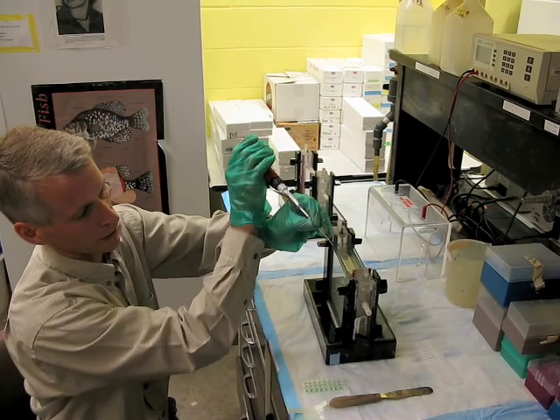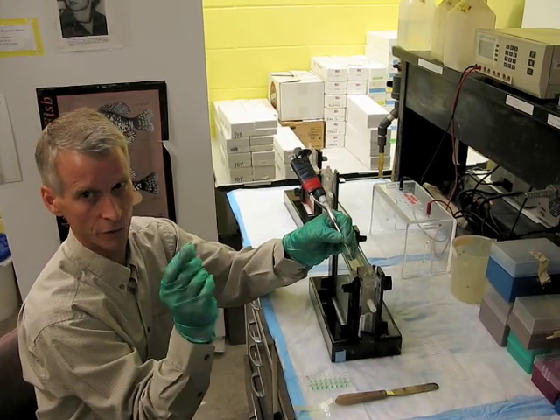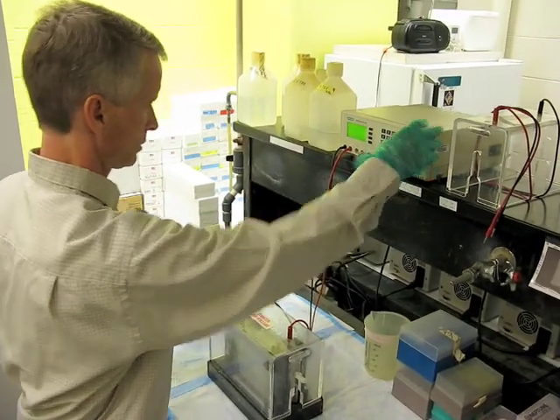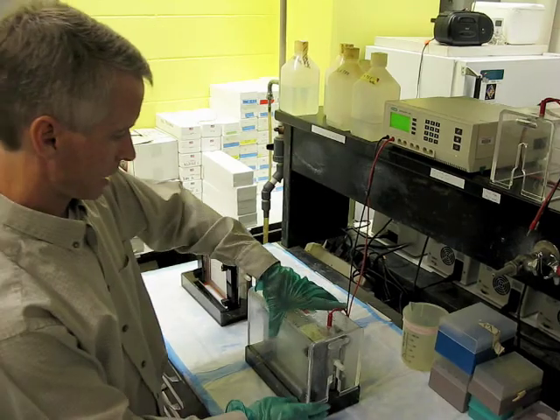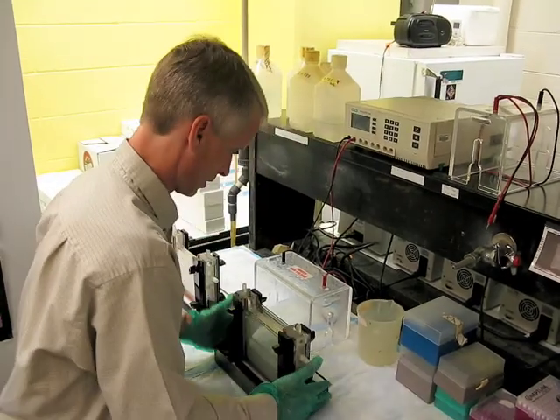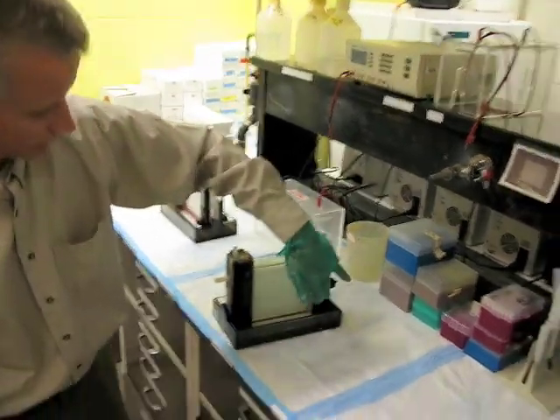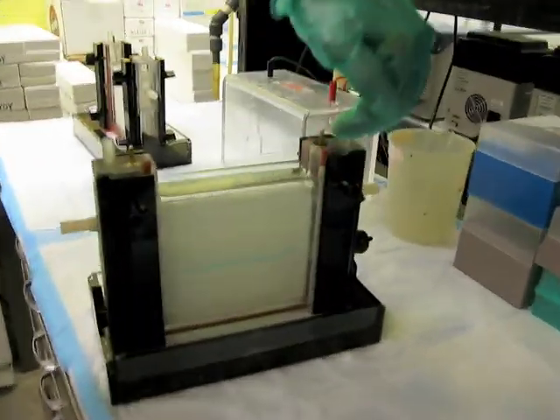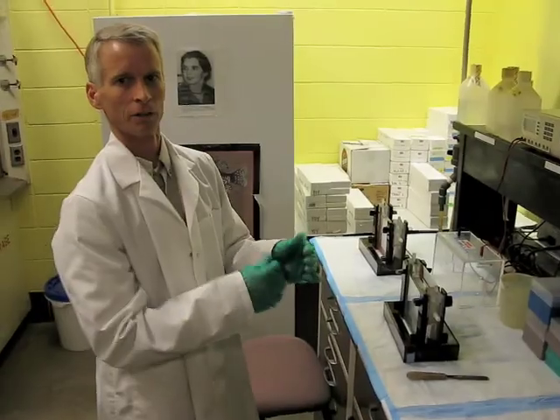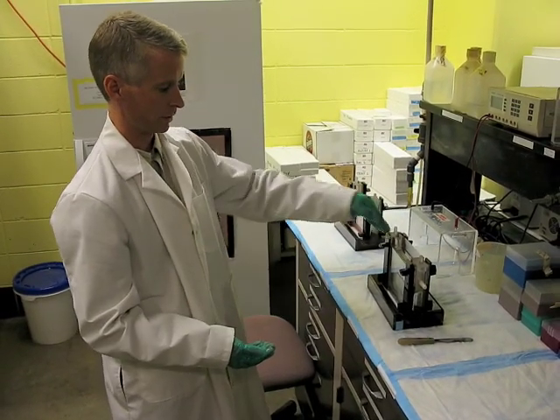I've got a really fine tip, because these plates are only 0.8 millimeters thick — the gel itself. And by twisting it around, it's probably hard to see on video, but there's a tracking dye that shows us we've got some samples running. The electricity has been pulling the DNA from up in the gel down to the bottom — the electricity is just pulling the charged DNA downward, because of the way our gels are set up.